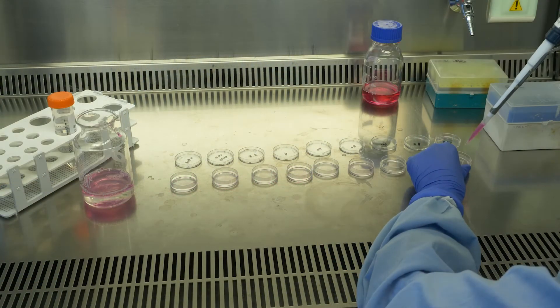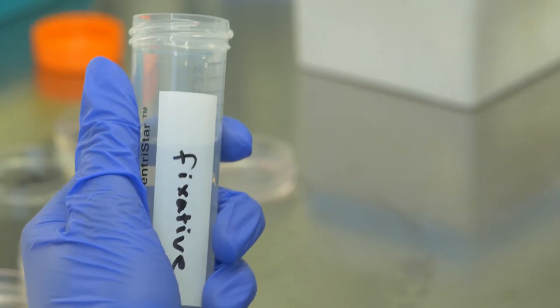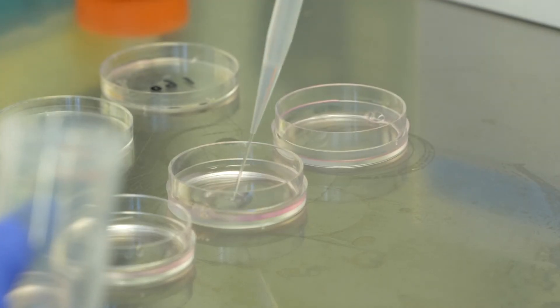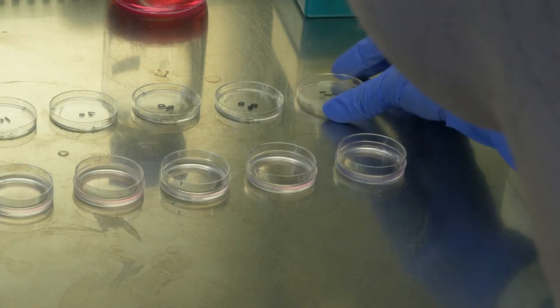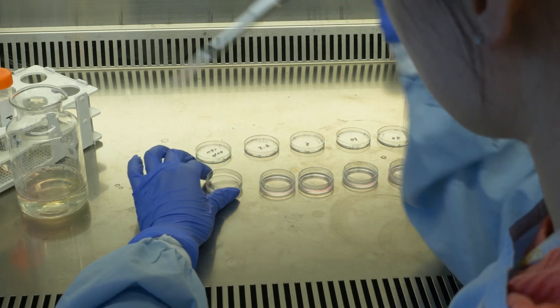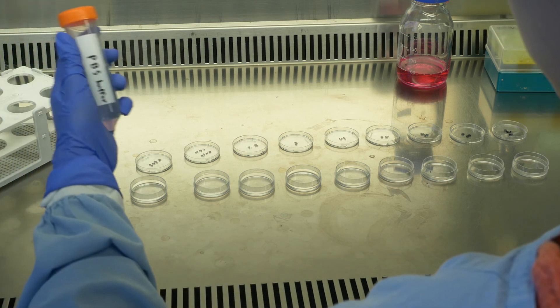Now JJ will remove the media, and we are going to fix the cells by addition of 1 ml fixative to each dish. The broad objective of tissue fixation is to preserve cells and tissue components in a lifelike state. In this case, the fixative is 80% ethanol. We add 80% ethanol to the dishes and wait for 15 minutes. We then remove the fixative from all the dishes — now we have fixed cells attached to the bottom surface. Instead of media, we add 1 ml of PBS buffer to each dish.